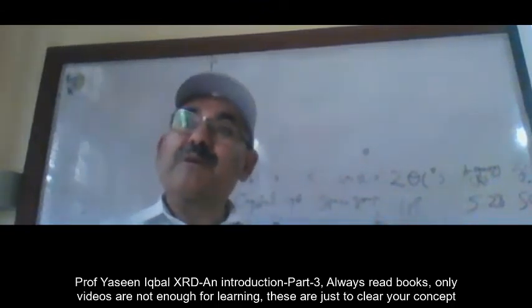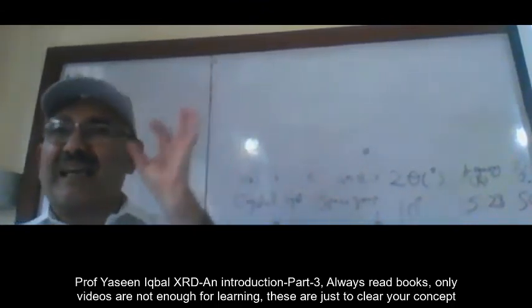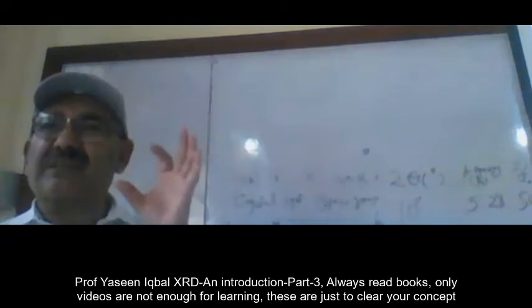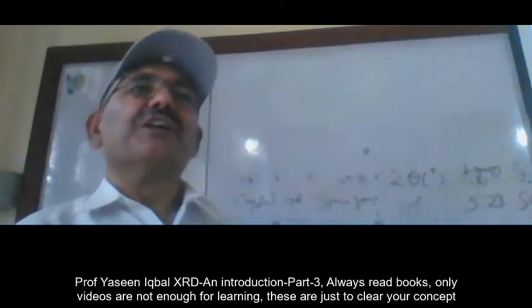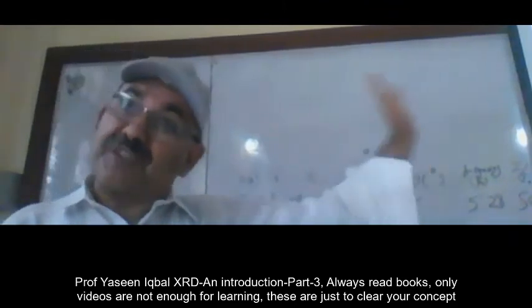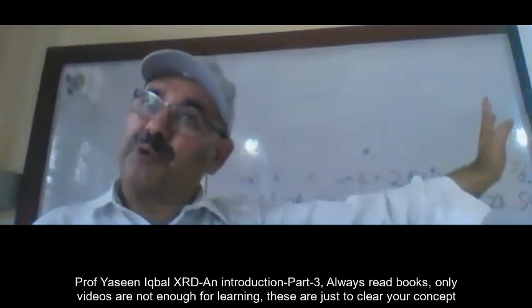But if your composition is exactly stoichiometric BaTiO3, then you should look first into BaTiO3.